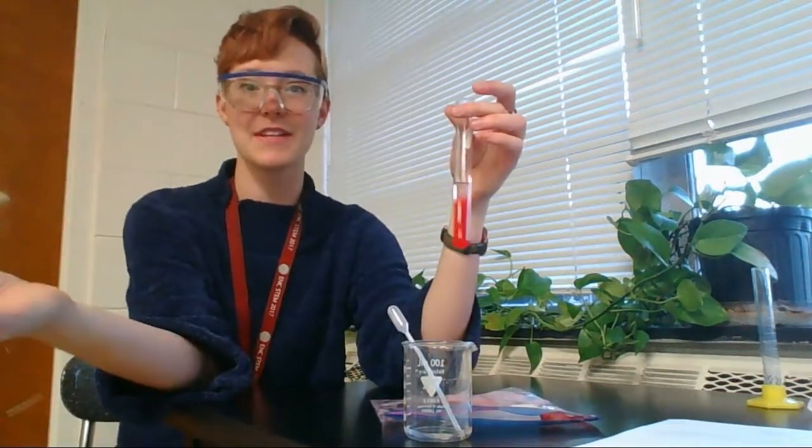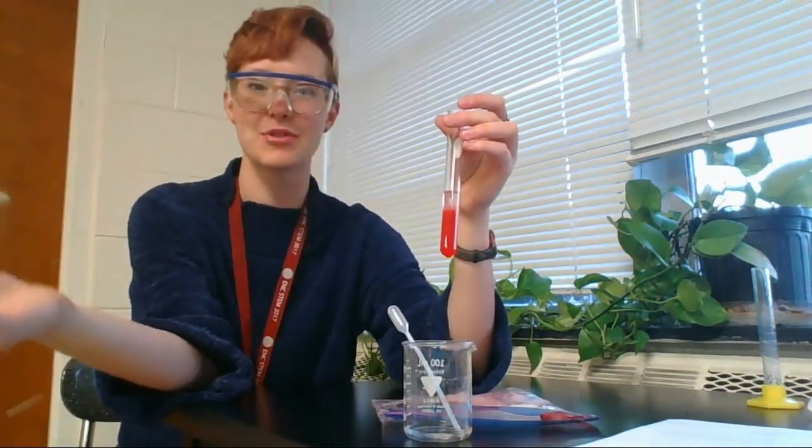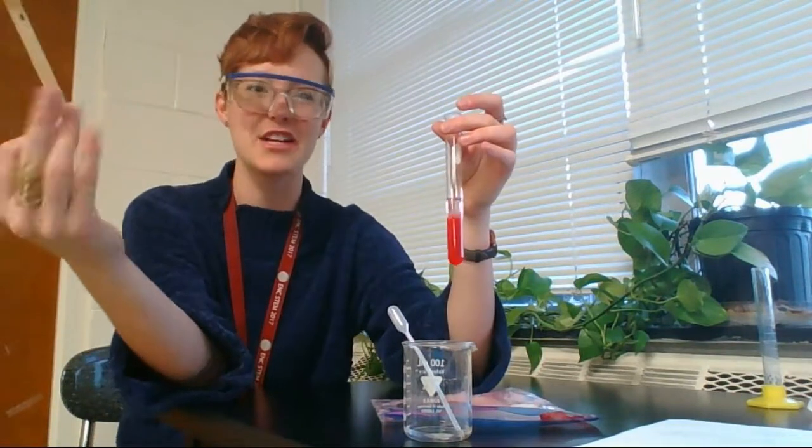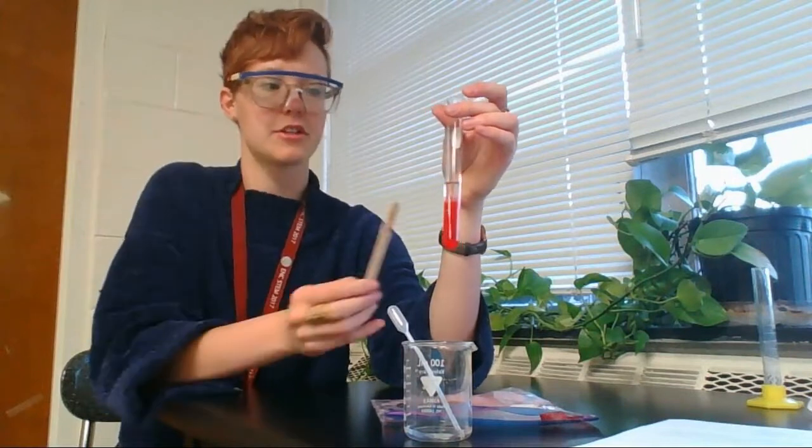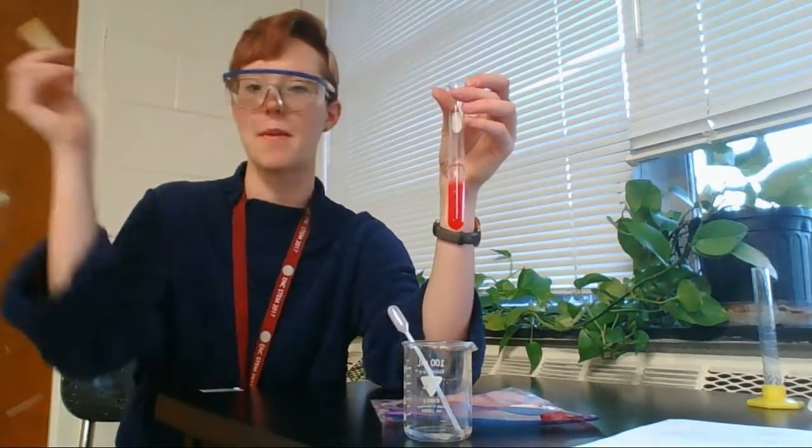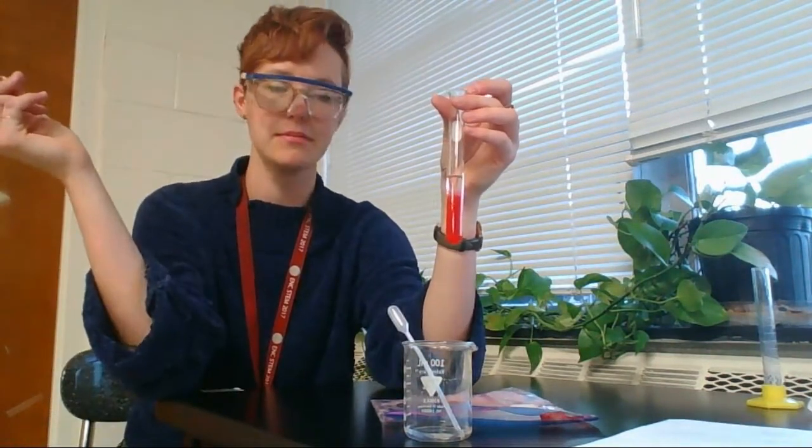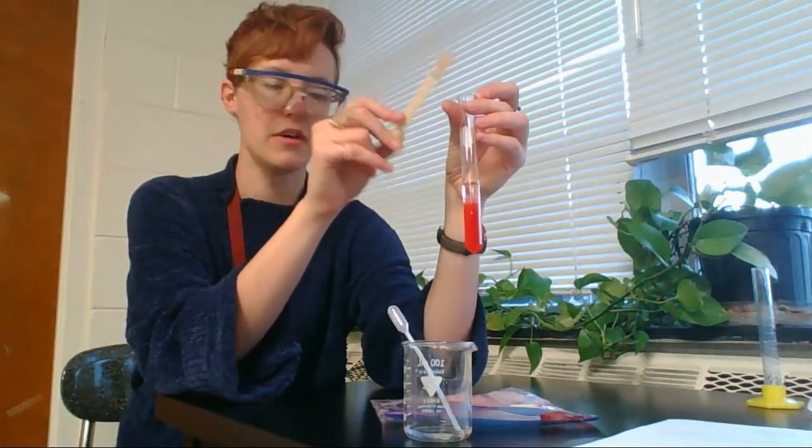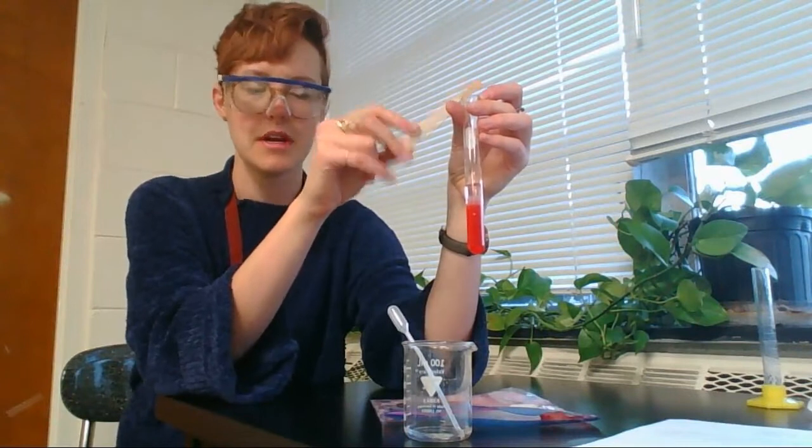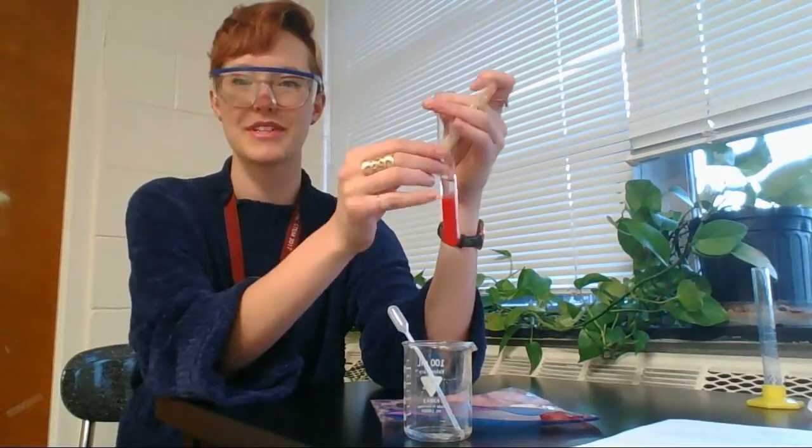That's it for this lab today. Hope you guys enjoyed seeing this snotty strawberry DNA. Make sure you clean up your lab. To do that, we're going to dump this in the back sink at the back of the classroom, throw away your paper towel, wash off your funnel and your test tube, and then you're done with class for today. Hope you enjoyed this lab.